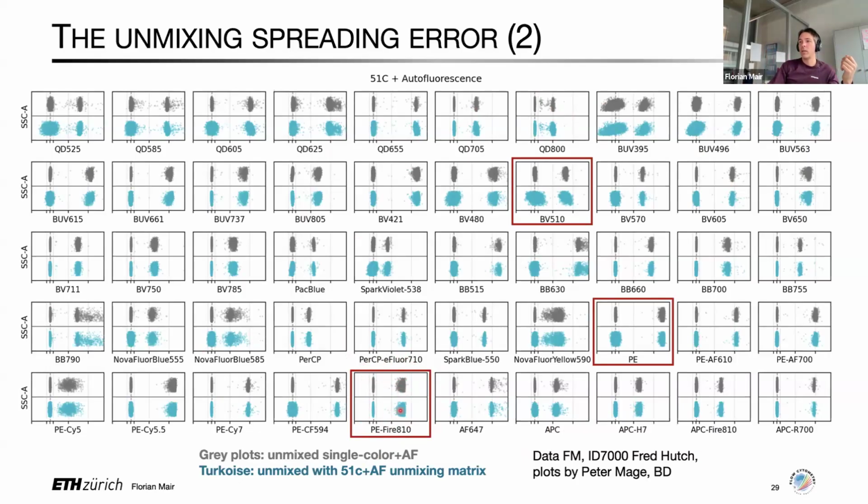And the lower turquoise plots are the very same raw data, the very same single stain unmixed in the context, in this case, of a 51-color unmixing matrix plus autofluorescence. And as you can appreciate here, there are some fluorochromes, like, for example, that PE-Fire 810, where nothing actually changes, or at least nothing obvious changes. While there are some other fluorochromes here, like, for example, PE, or more pronounced even BV510, where you can see a drastic increase in noise, variance, or spread, however you want to call it, of all the cells in your measurement, or the negatives in this case where it's visible. And you can see that this happens in a fluorochrome-specific fashion. And this, of course, always depends on the fluorochrome signatures that you pack into your complex matrix, which at that time were the 51 fluorochromes that we wanted to use for the panel at that time.